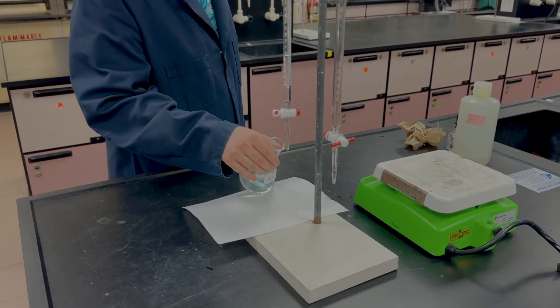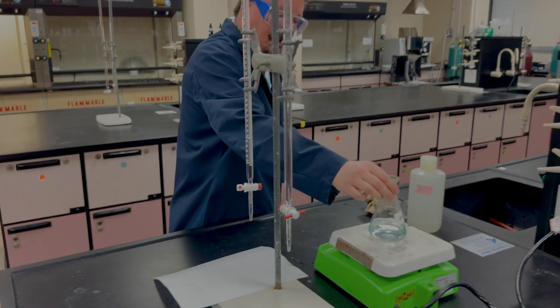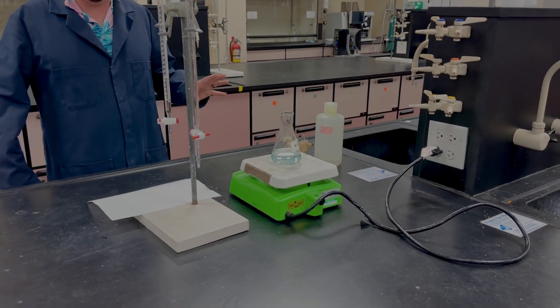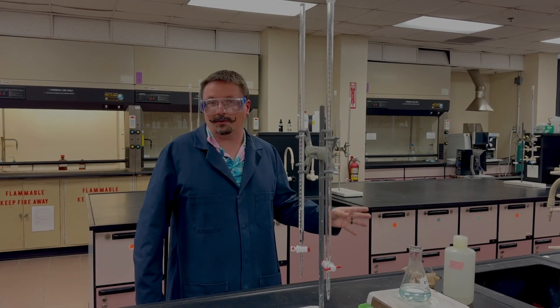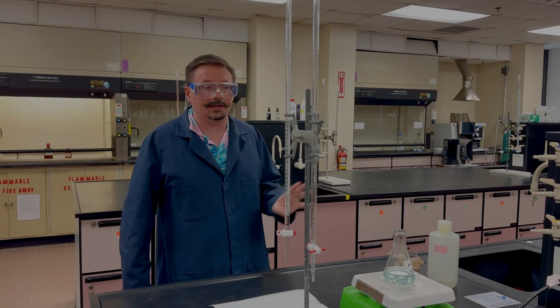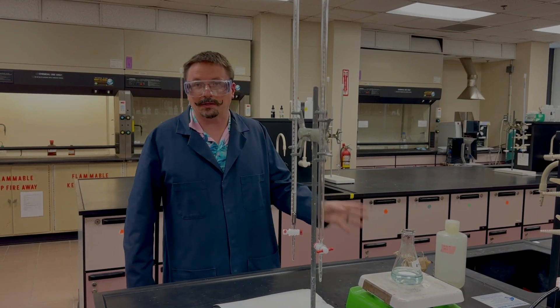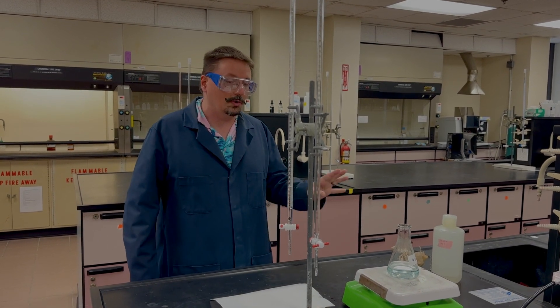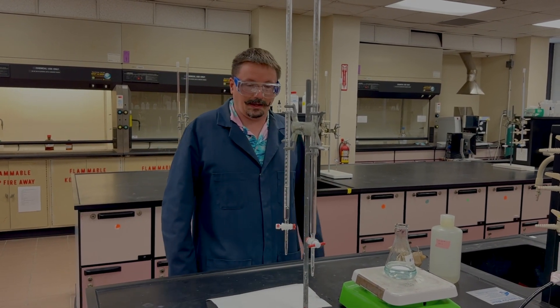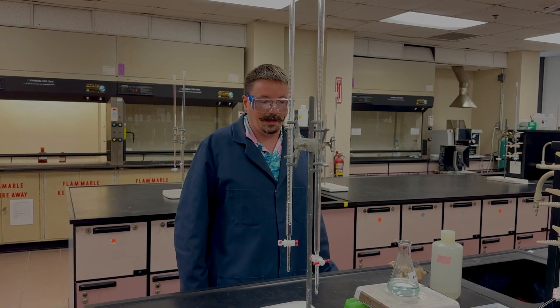If you get the green, that's great. Even if you get yellow, take it, put it on that hot plate, boil it. As long as you can get it to go back - either get it to go yellow to blue, or even yellow to green is fine. Or ideally you got the green and you boil it and get it to blue.